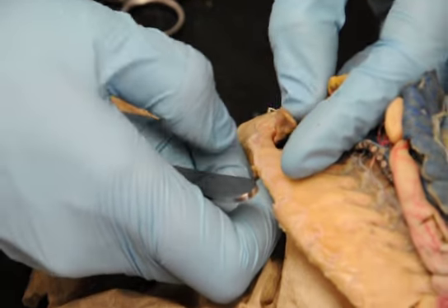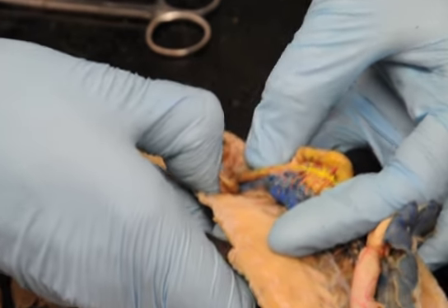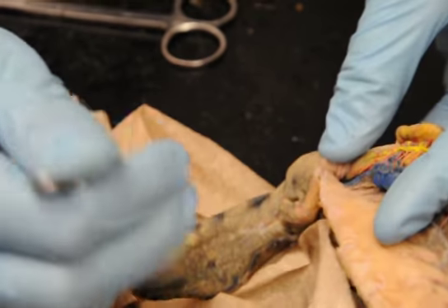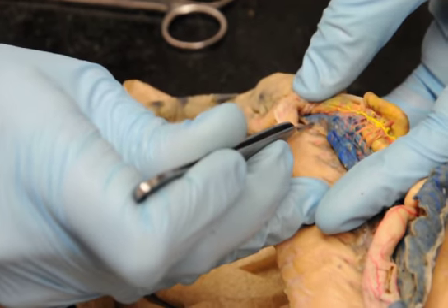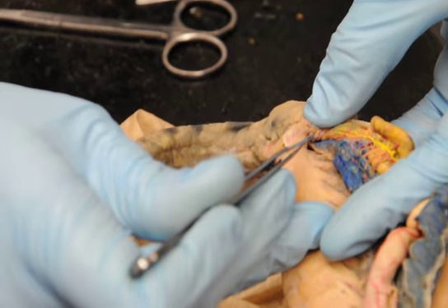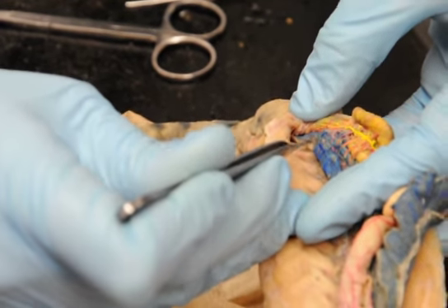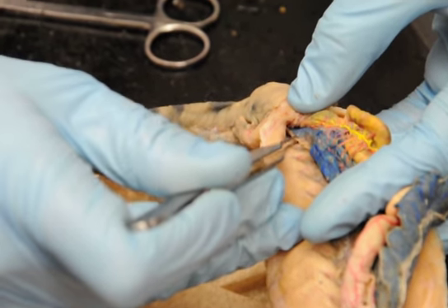And pull this apart just a little bit more. Make that a little easier. So that's the kidney way down here. You have a renal portal vein along the edge of the kidney, just like the shark. Usually not something you can really see though. The mesonephric ducts kind of cover it and it's not well injected.